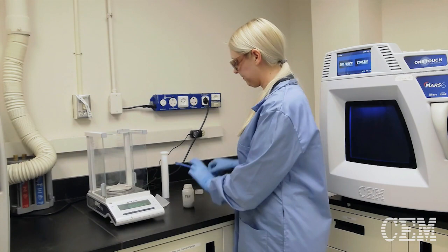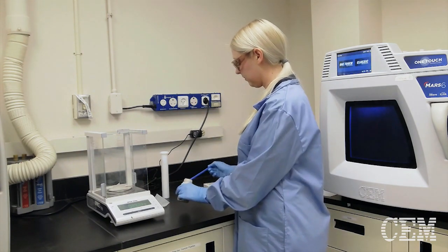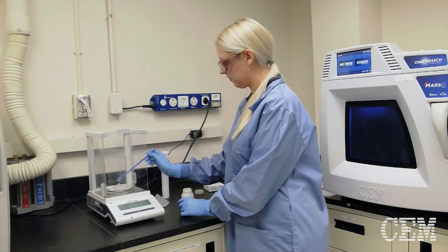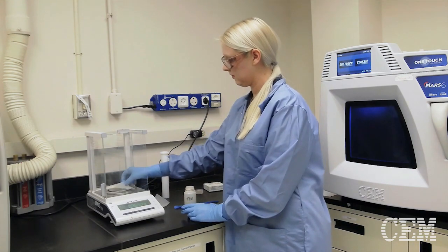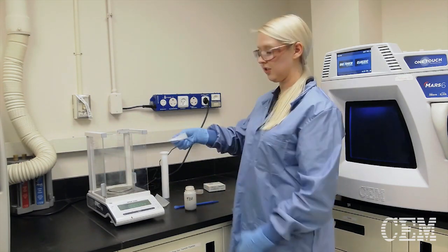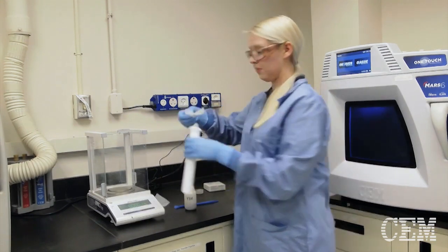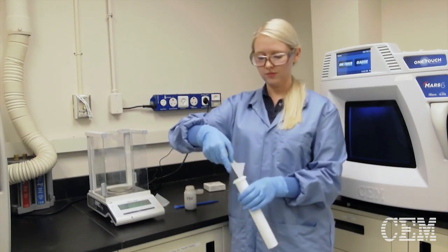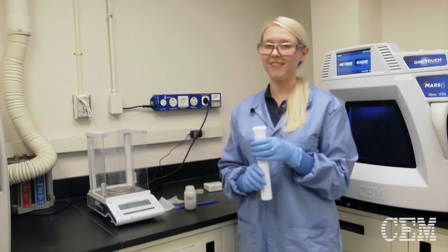Let me show. Just like this makes it easy. And that's it.